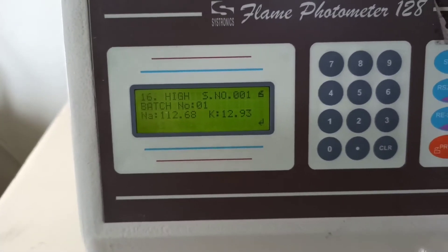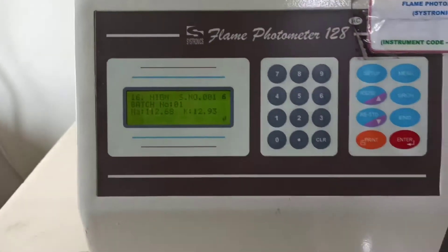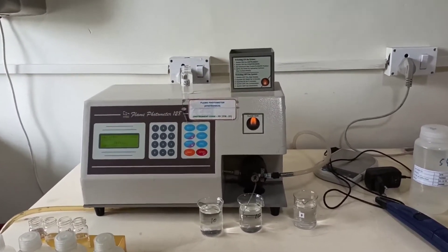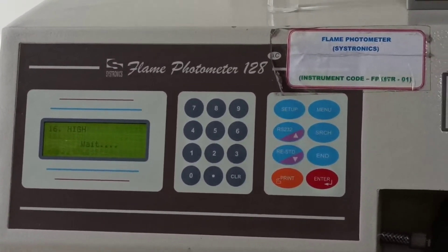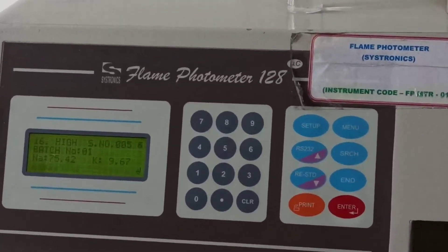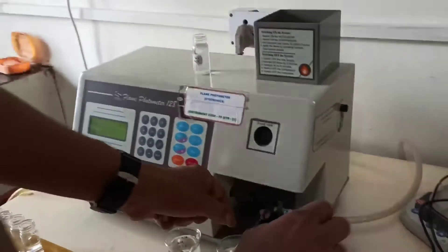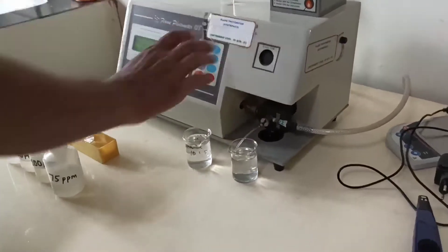Batch number one has started. Now we are taking the sample and we get the result — 83 point something. You can see different samples giving different results. The flame intensity is too high for this sample. We get the result: sodium is 75 and potassium is 9.67. Please note this: if the concentration is too high and out of the calibration range of the instrument, then you must dilute your sample according to the conductivity of the sample.